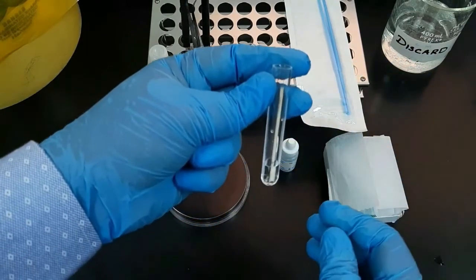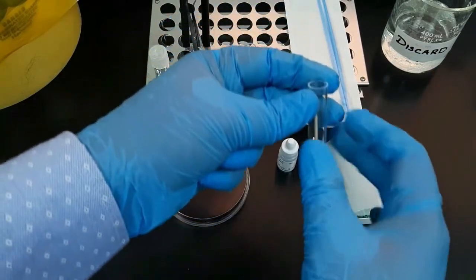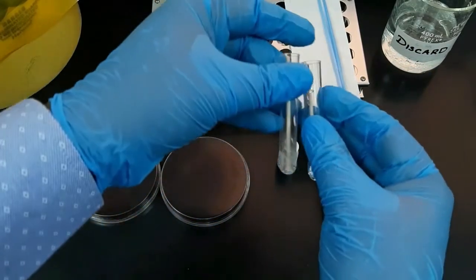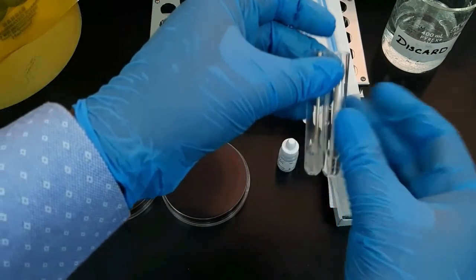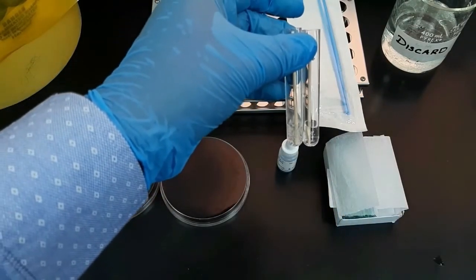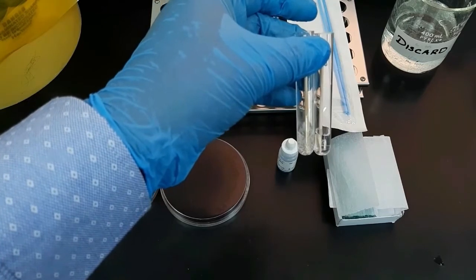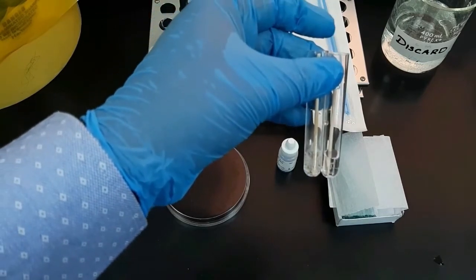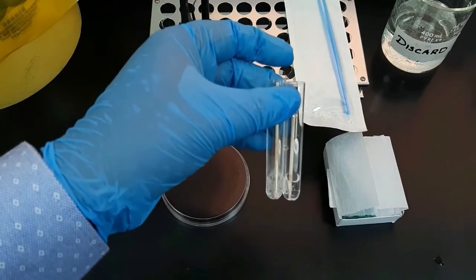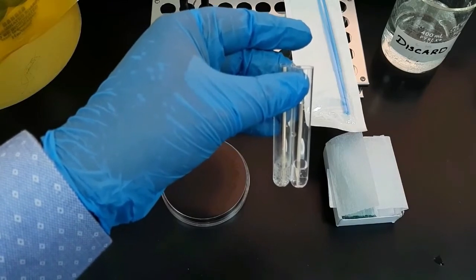In the negative control tube, no bubbles should form, which is considered catalase negative. Please remember to avoid taking colonies deep from a blood agar plate, as this may give a false positive result. Thank you.